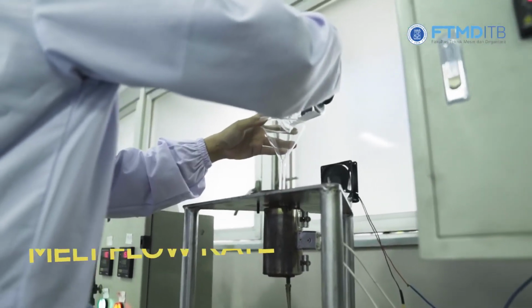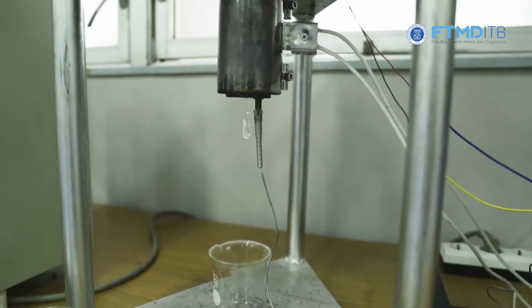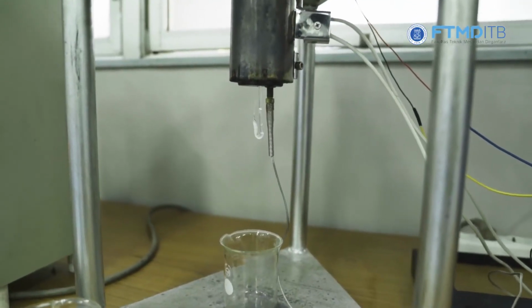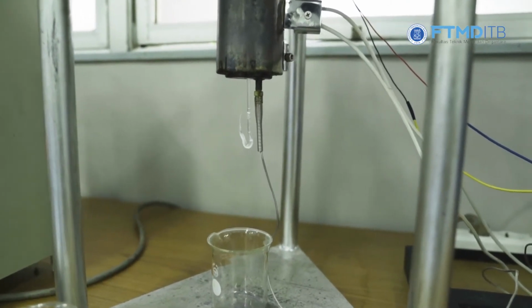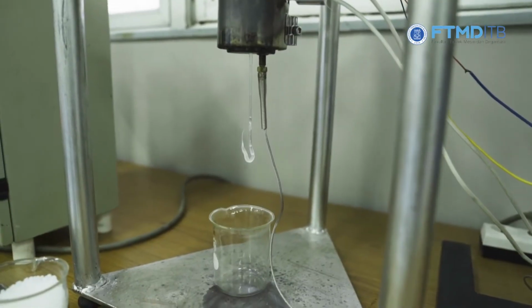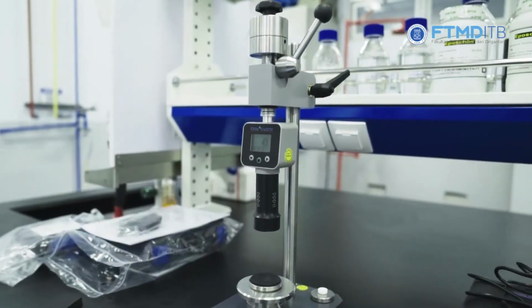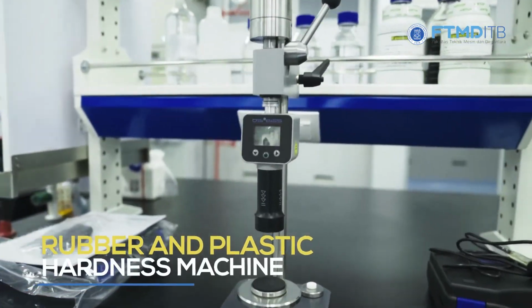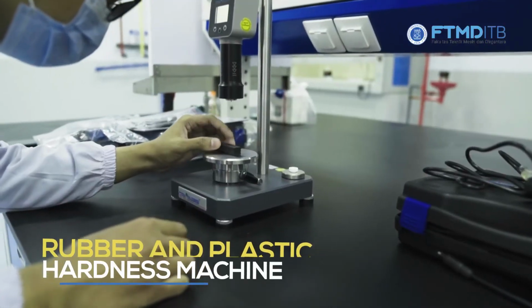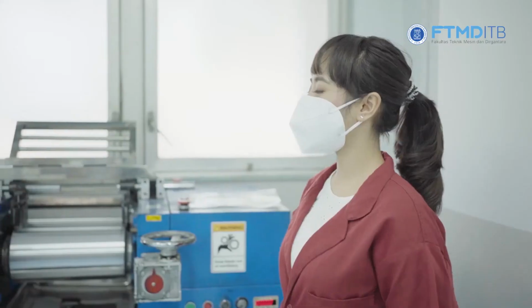This is a melt flow rate machine. This machine is also used to indirectly measure the viscosity of polymers, especially thermoplastics. Plastic resin is melted under a specific time and weight, and converted to the MFR value based on the standard. Here, we have the rubber and plastic hardness machine. We can test rubber with a wide range of hardness based on Shore A and Shore D.